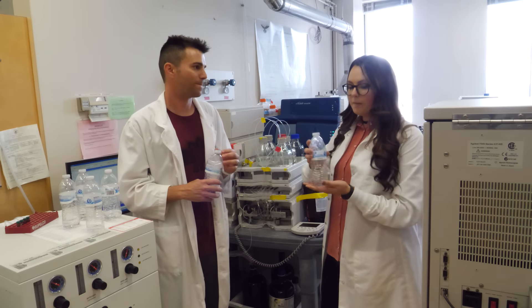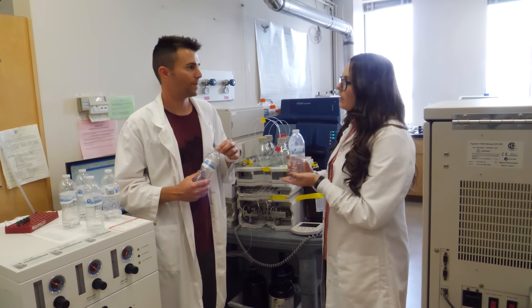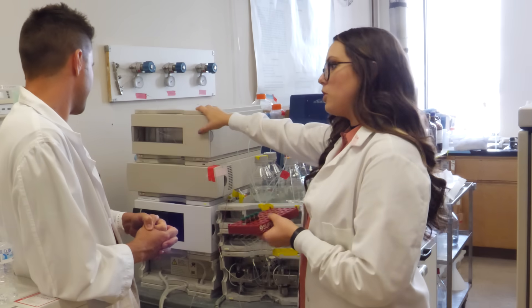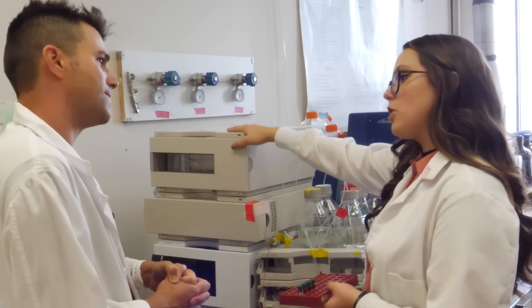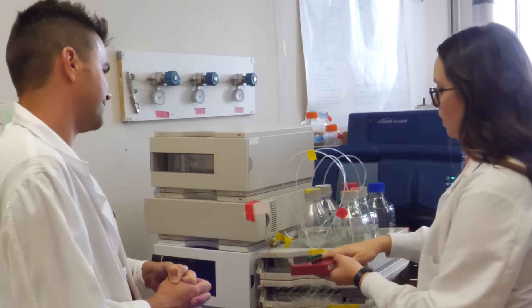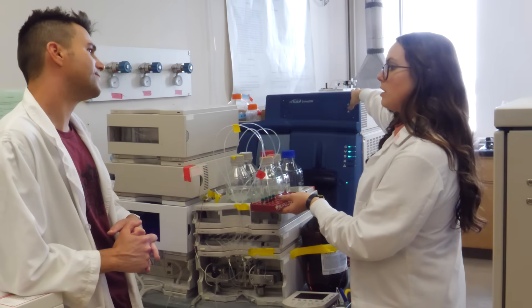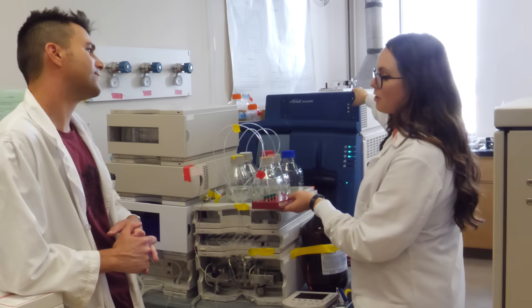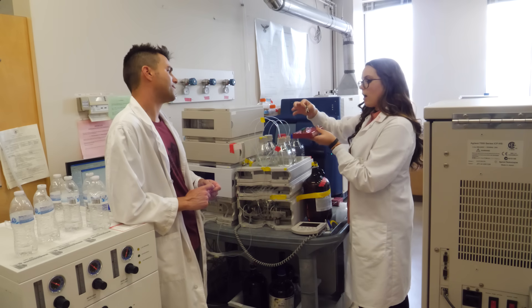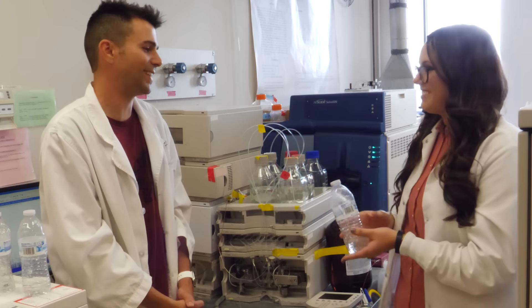We're going to take this sample, bring it over to our sample prep bench, filter it, and transfer it into some special vials into this instrument, which is a liquid chromatography system. This instrument is going to concentrate our sample before passing it on to the second instrument, which is a mass spectrometer. The mass spectrometer is able to detect the individual artificial sweetener molecules one by one. Let's get to work.